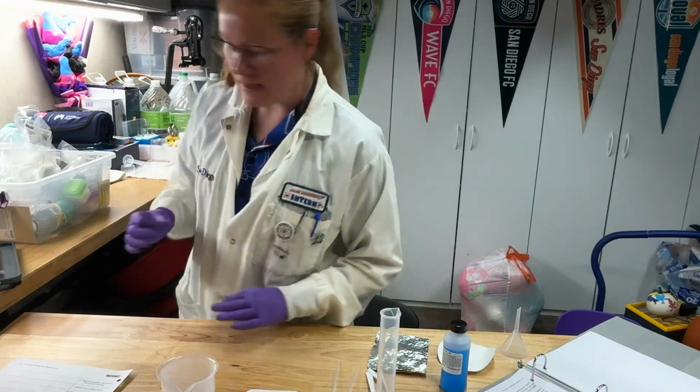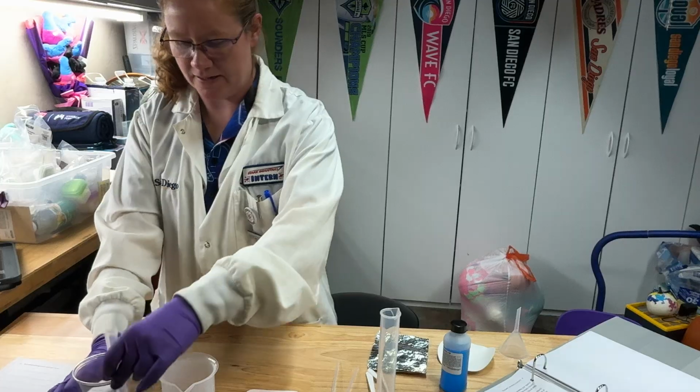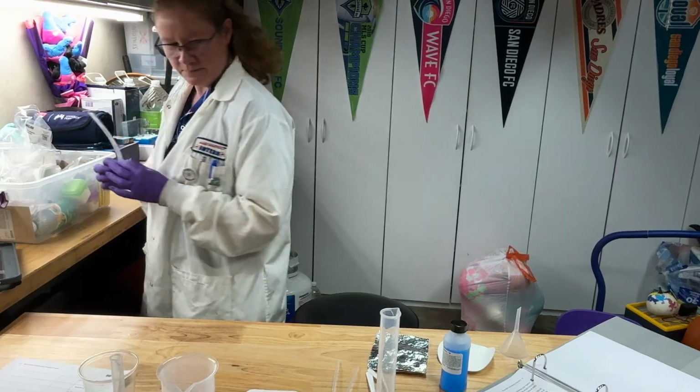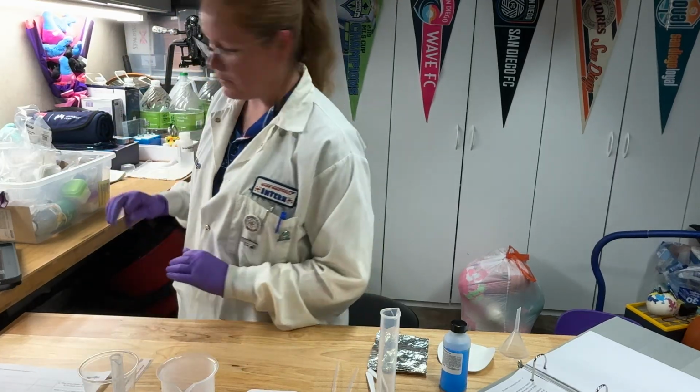We also recommend that you have your 10 ml graduated cylinder and an extra cup handy. And then you will also need your ruler, and some sodium chloride.